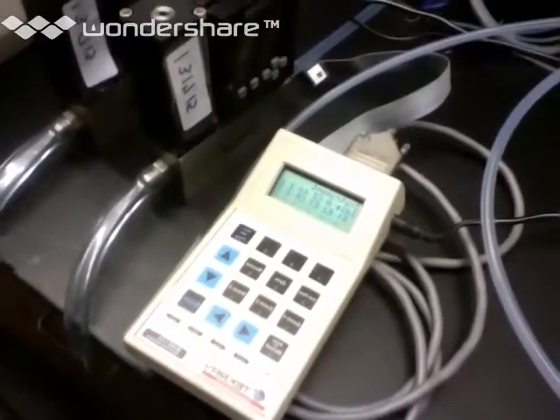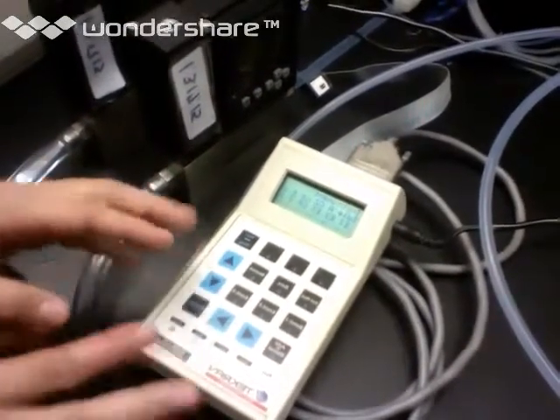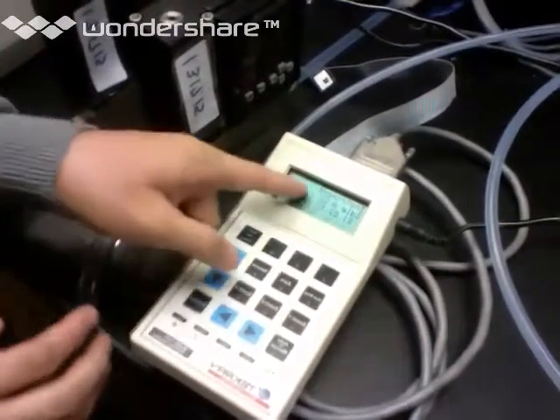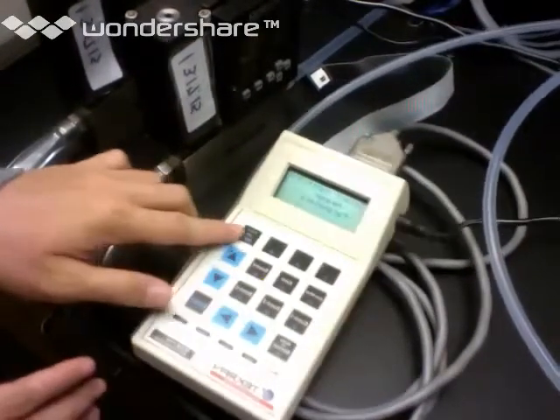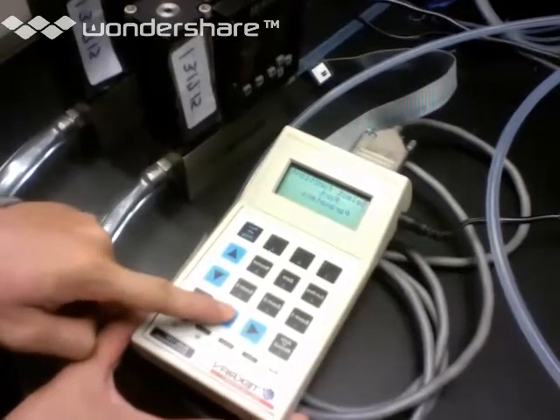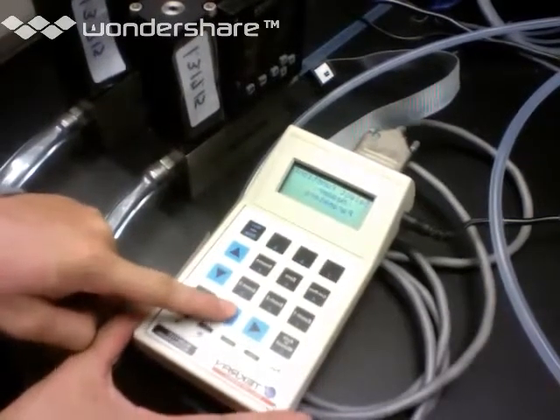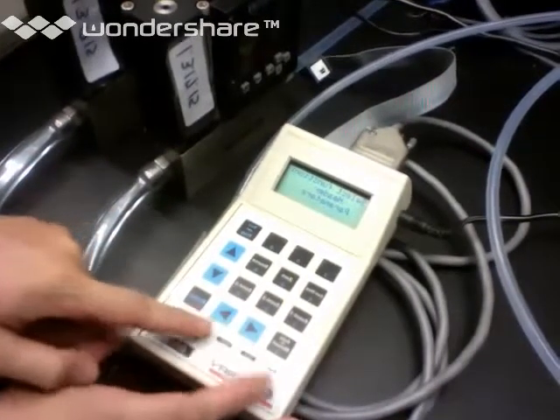Okay, cool. So, this is the 4-port sampler. Right now it's in idle because the instrument is idle. Generally, if you have to do anything, you're going to go into Run Program. You have several options here: select function header parameters, port parameters, hardware parameters, and then it just goes back that way. Scroll using these arrows here. Actually, the side arrows help scroll.